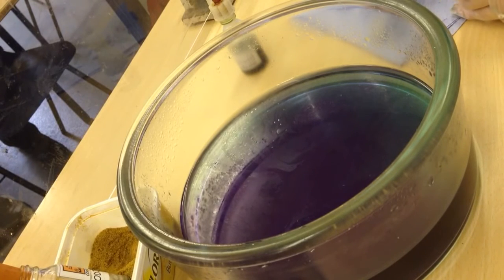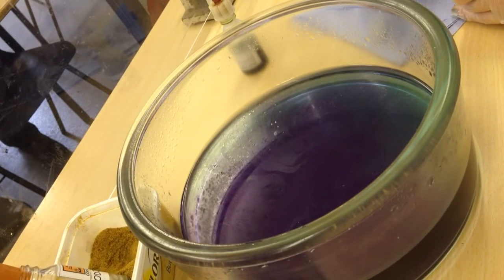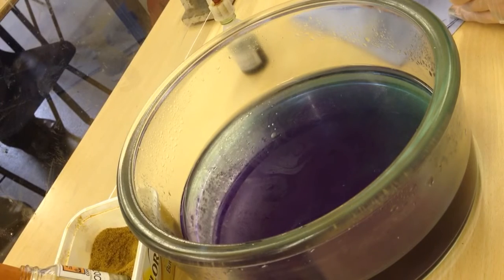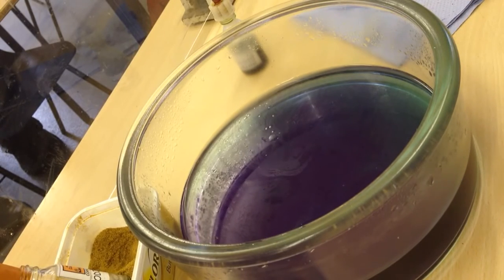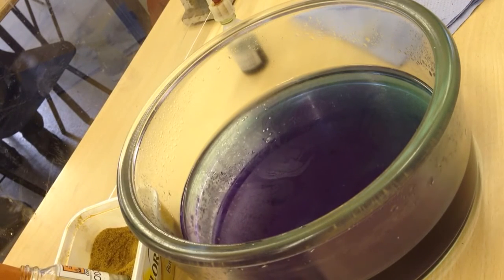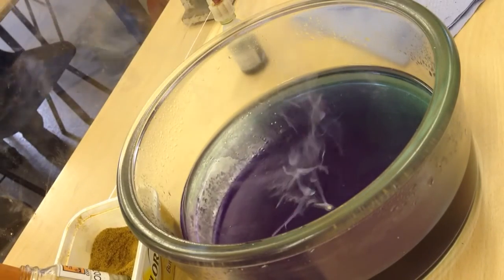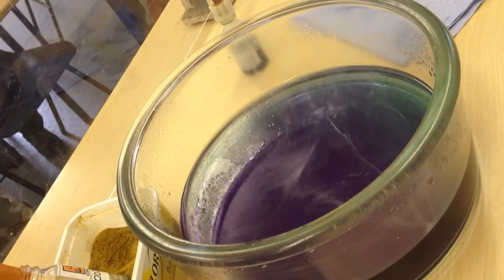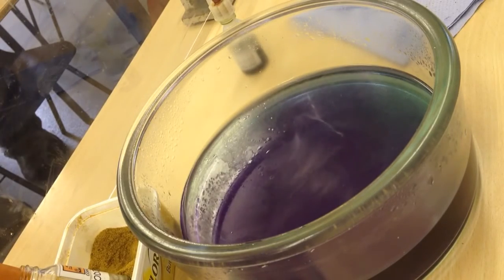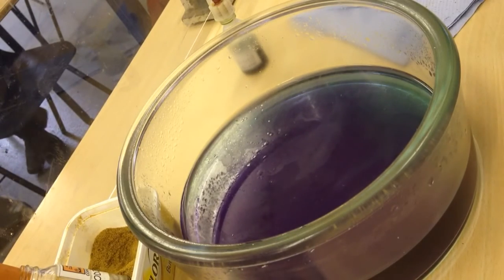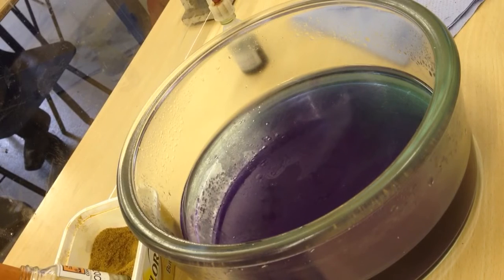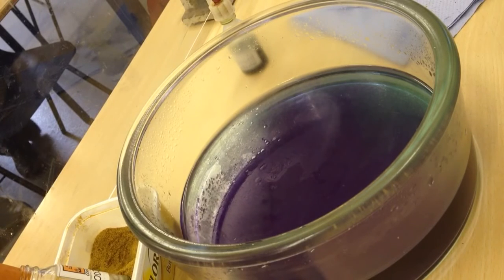I'm just going to dry this one off a little bit, see if we can't get it to react a bit faster. Okay, are we ready for potassium? Are we ready? Yeah. It is, isn't it? Do you want another one? Yeah. There's only two left. Exactly. Two in there.